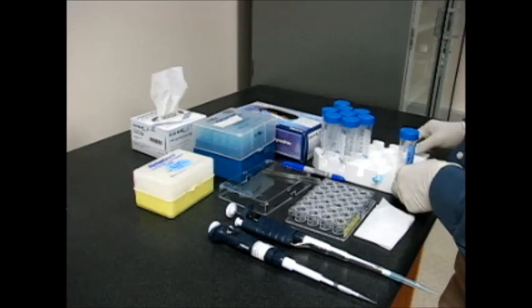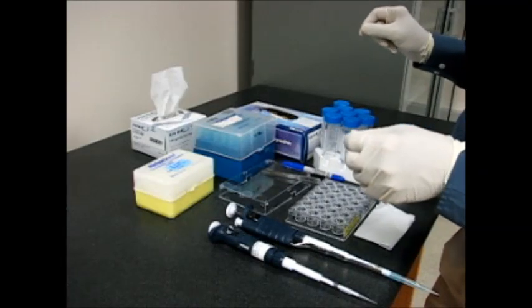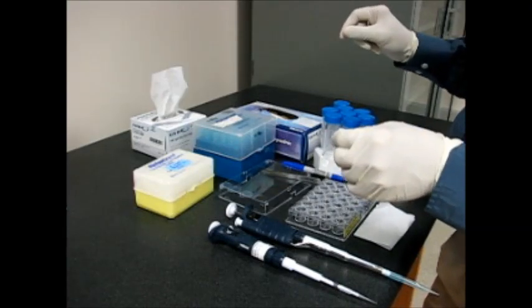The setup is now ready to start setting up vapor diffusion hanging drop protein crystallization.